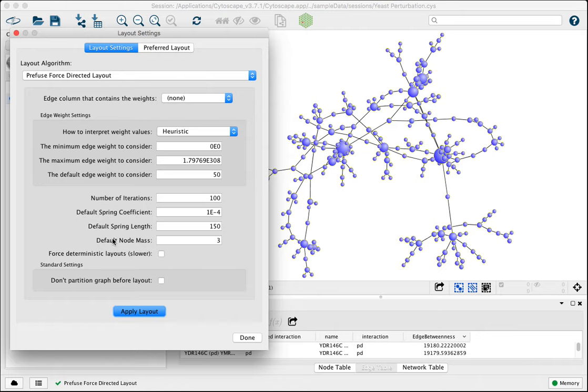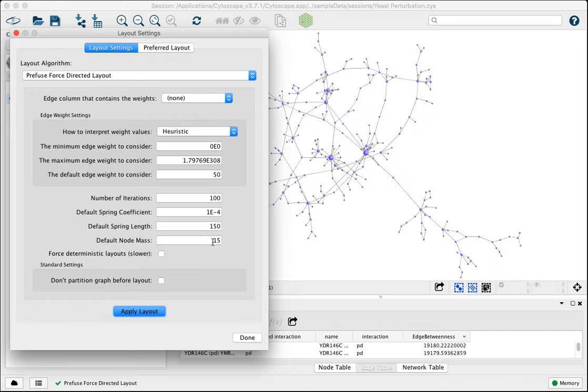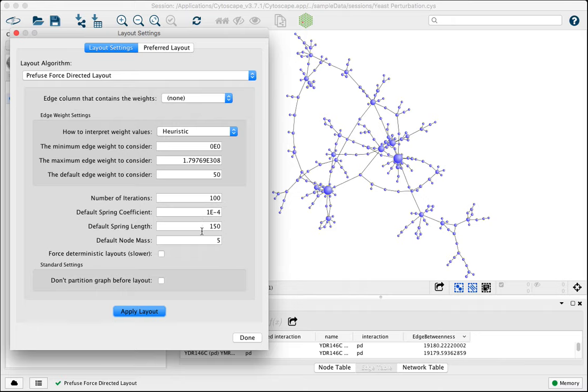And then the final thing I wanted to demonstrate is node mass. So imagine this is how heavy each of these nodes are. If they're heavier, they're not going to be able to move as easily, and they're not going to be able to bunch up as easily from their starting position. So let's make these a little heavier. And now they're more spread out. If we increase this a lot, they're even more spread out, right? And if we decrease this number, it's a very light node mass. That means given the spring and the spring length, things can be bunched up together. So dramatically different layouts just by tuning these three variables, these three default values. So you can get things exactly how you like them without having to come in and manually move things around.